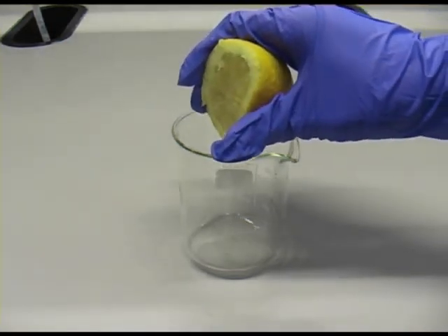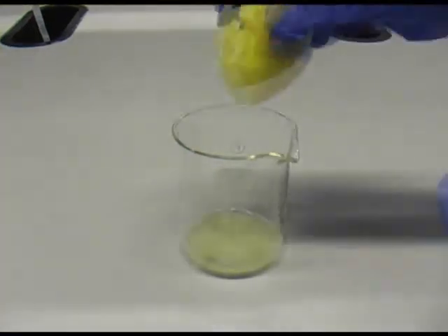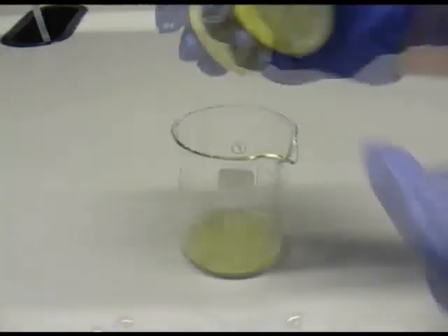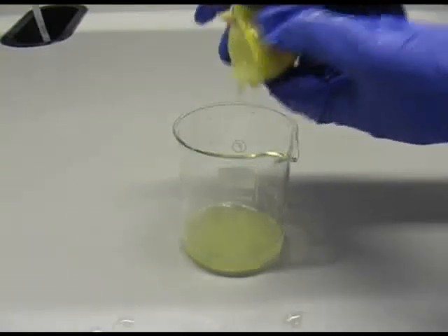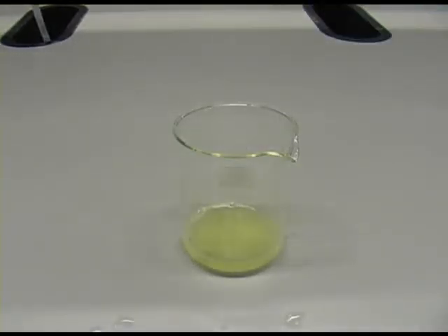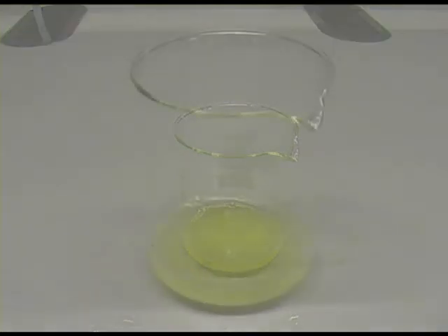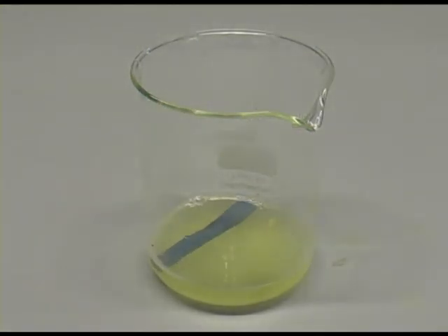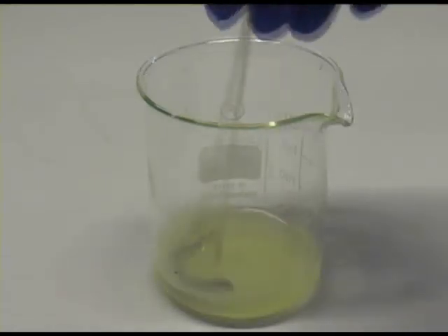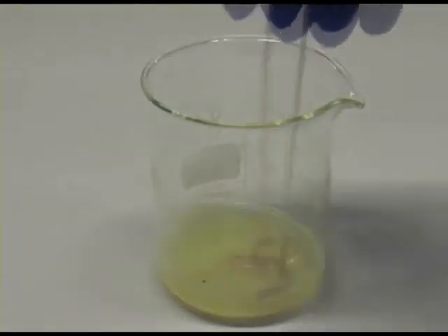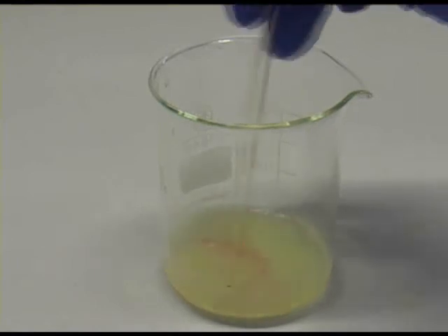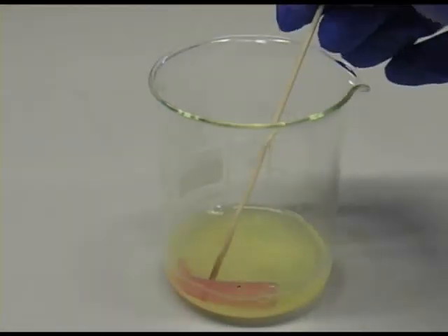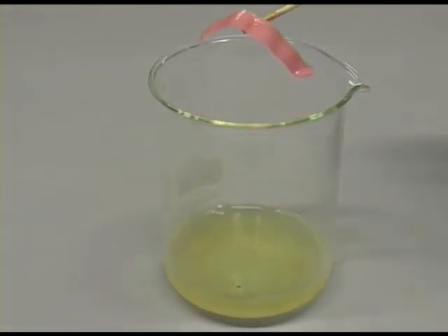Now, what happens if we actually juice a lemon? Spin it up a little bit. Watch out for the splashes. And now, let's test it. Blue litmus. As ever, give it a little bit of a stir. And you can see the blue litmus has turned red, meaning that this lemon juice is also acidic.